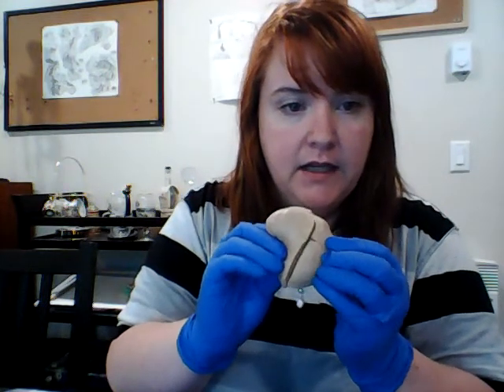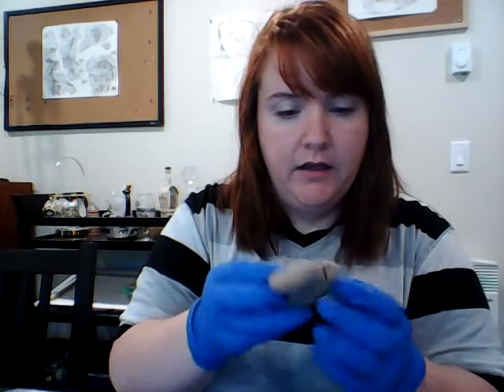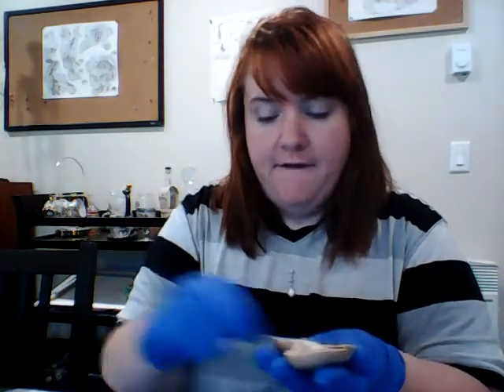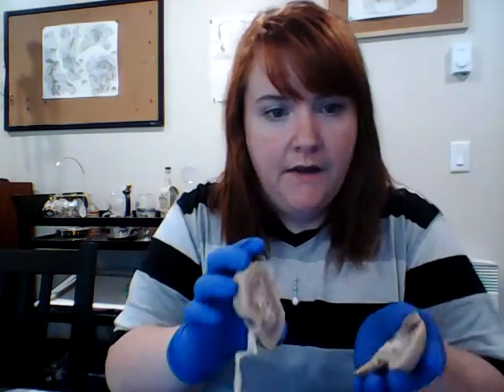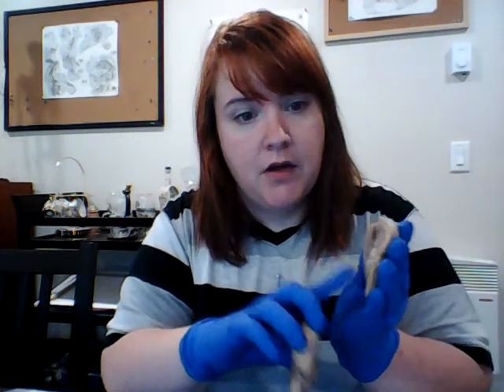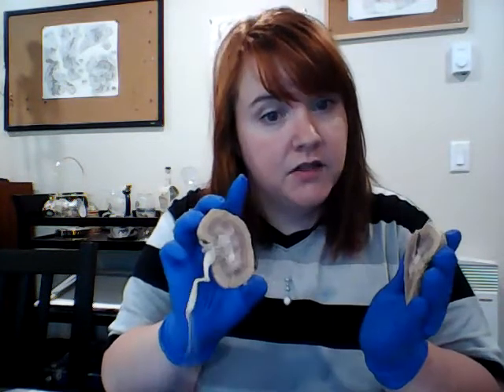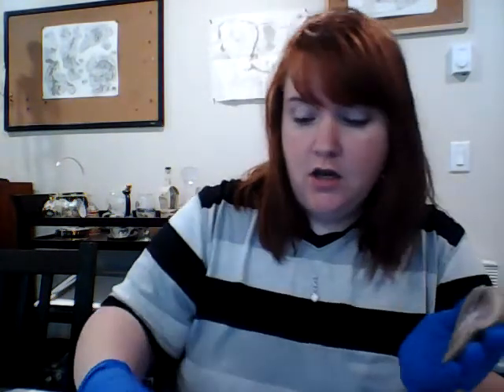All right, so today we're just talking about the kidney, and I dissected it into two parts here. It kind of came a little cracked on the outside. That's not from my dissection, so you have to bear with me a little bit. I cut it into two different halves, and I found that the side that actually showed the most structures was the smaller side here. So for the most part of the video, I'm going to be talking about this side, and then I'll switch over to here for the bigger structures.